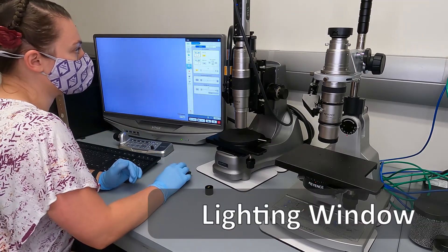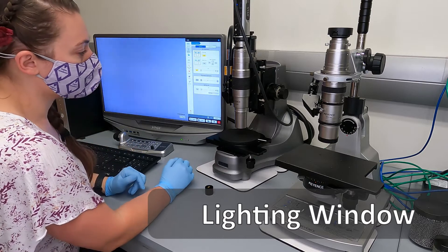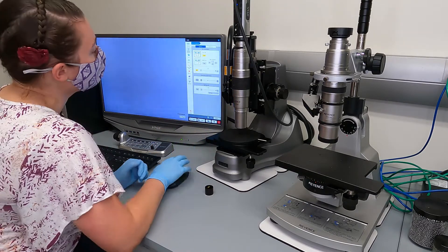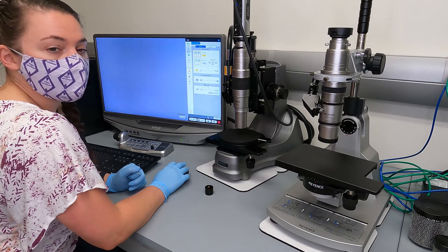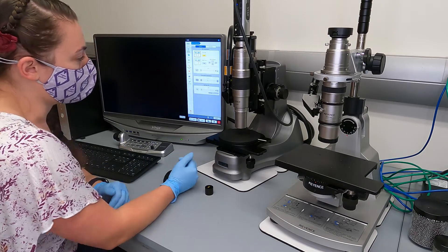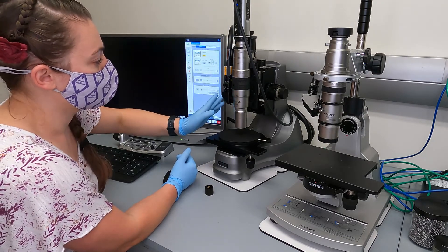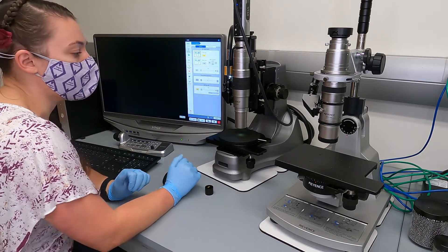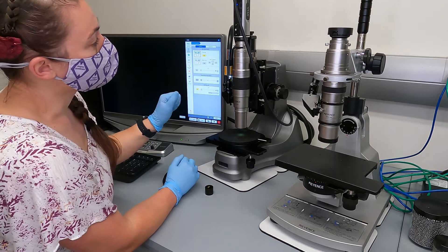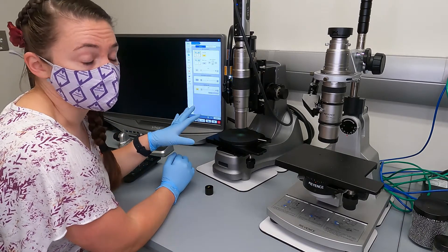The first option is lighting and brightness. The epi illumination listed at the top is coming out of the camera, and for any of the lenses that have this lighting unit on the side, we don't want to use that camera lighting. I'm going to turn it off by clicking this button that's currently yellow — now the screen goes dark. I want to turn the lighting unit on. The lighting unit is mounted in the back as a separate piece, and a fiber optic cable transmits the light into this set of mirrors. Both of these lights when on are very bright, so if you're removing them to switch, it's best to turn them off or at least point them away from yourself and other people.